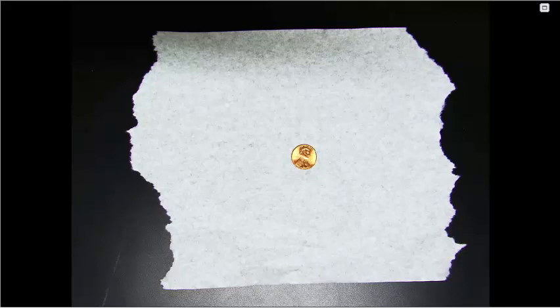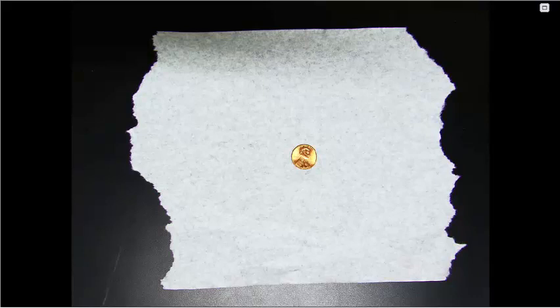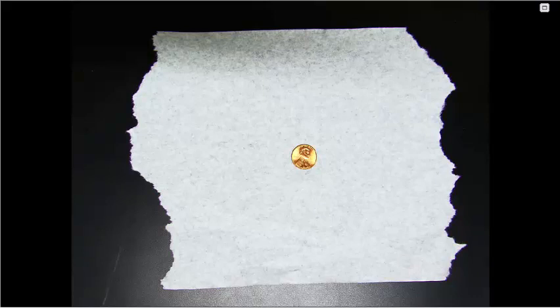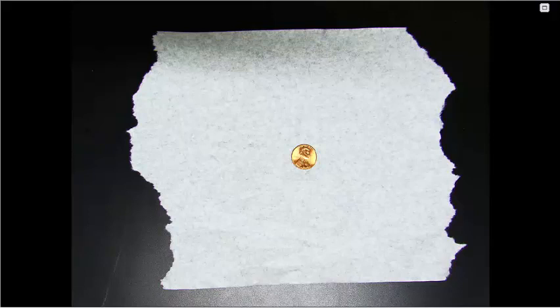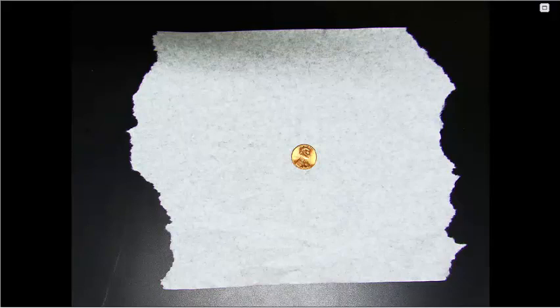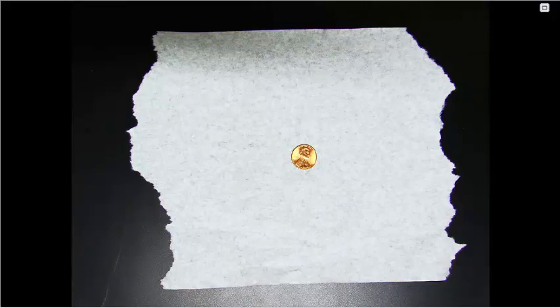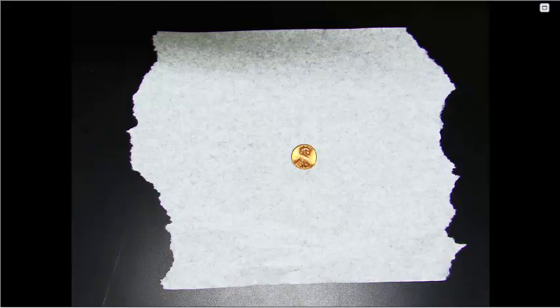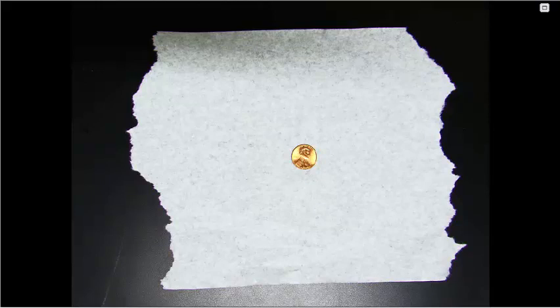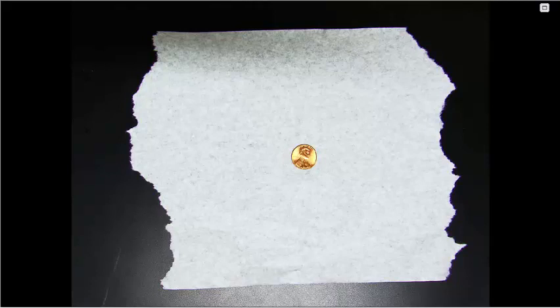For your procedure you will want to start with a single piece of paper towel out on the tabletop and a penny laying on that paper towel. As a group you will want to decide if you are putting the penny heads up or tails up. I chose to do heads up for this example.